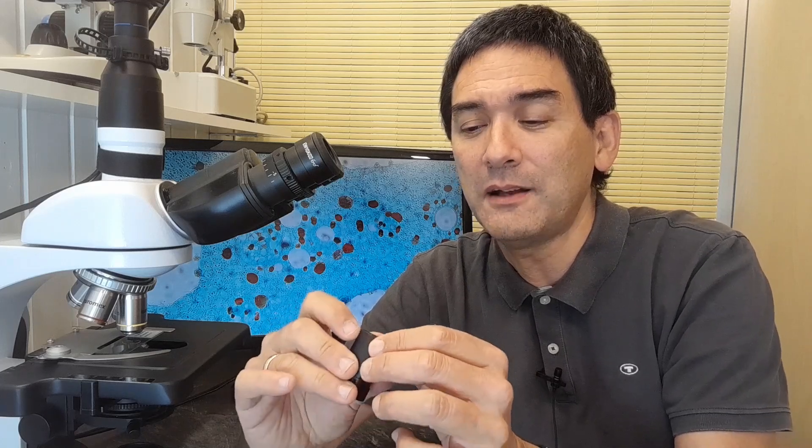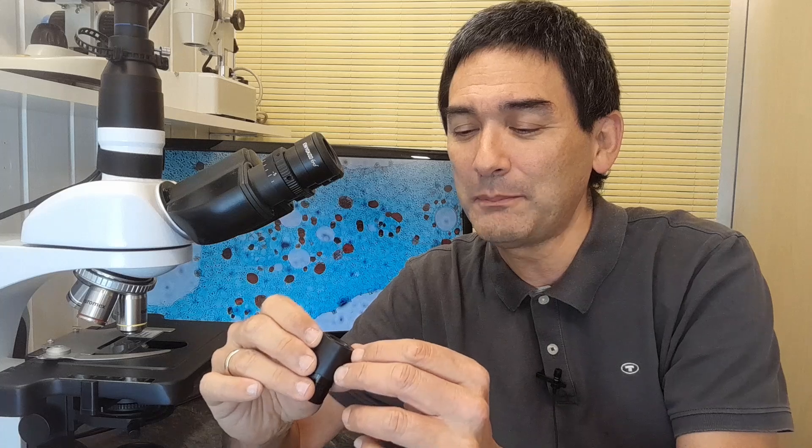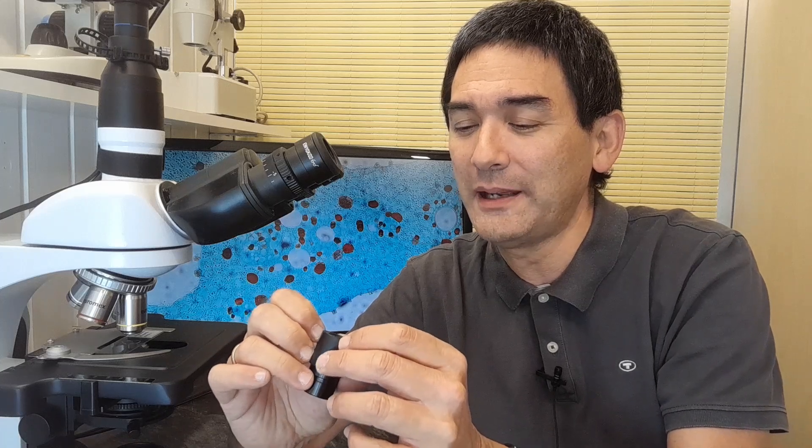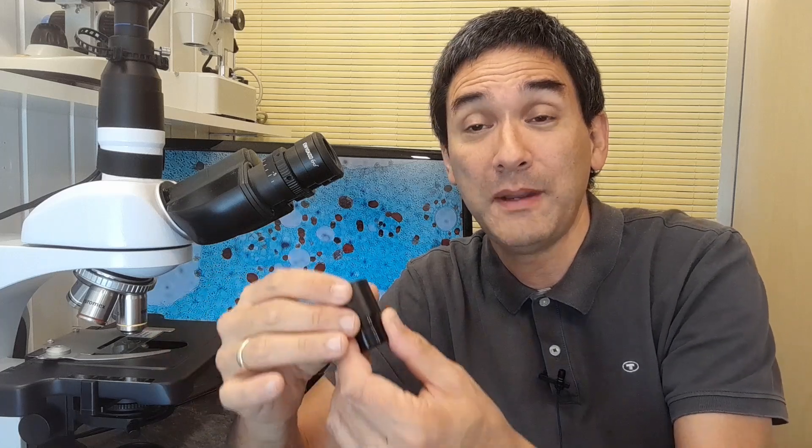Many eyepieces have 'WF' written on them, which stands for wide field. Interestingly, a lot of eyepieces have that even though they're not actually wide field. This one, for example, also says WF 10X — wide field, 10 times — but honestly it's not a wide field eyepiece. It's a fairly low-cost one made fully of plastic. I think there might be marketing reasons behind that.